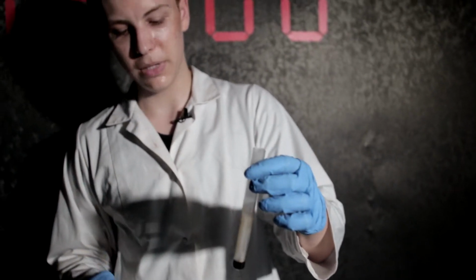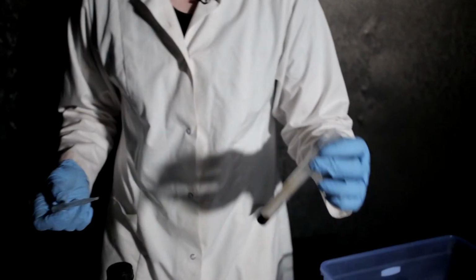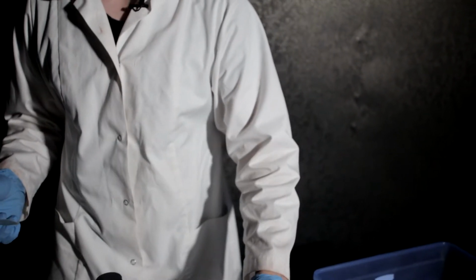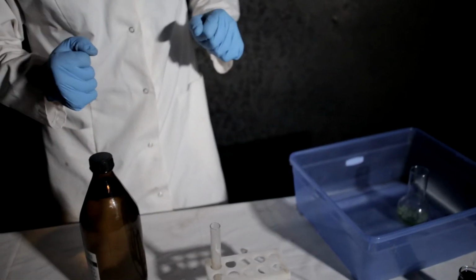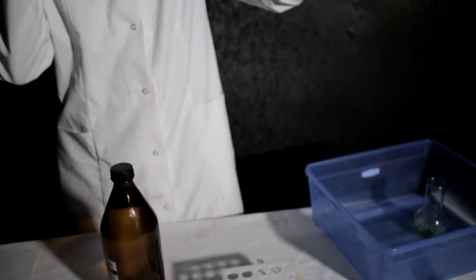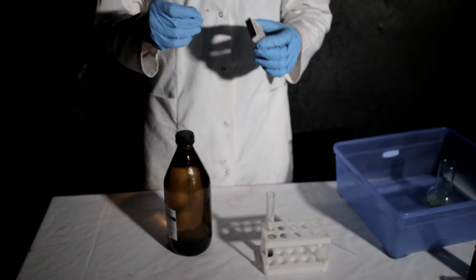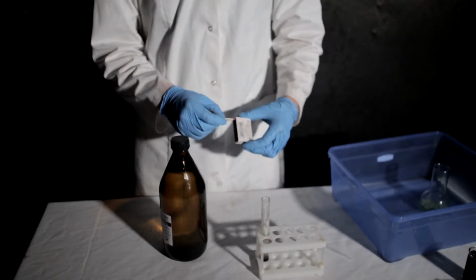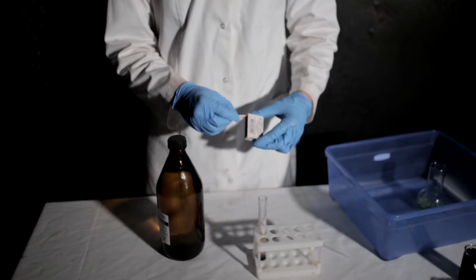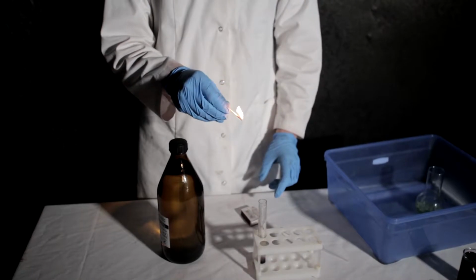Okay, let's not play with it. Wow, the amount of heat emitted is just enormous. So the next thing I should do, and then I'll explain the processes, I'll demonstrate that there is indeed oxygen gas. So I will take some matches. A splint is lit and allowed to burn for a few seconds, then blown out by mouth or shaking.